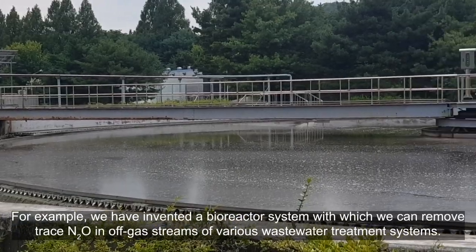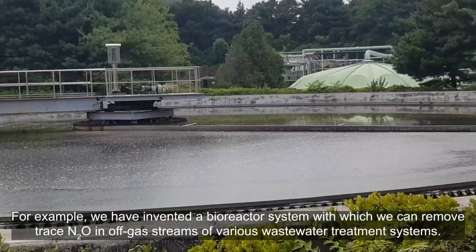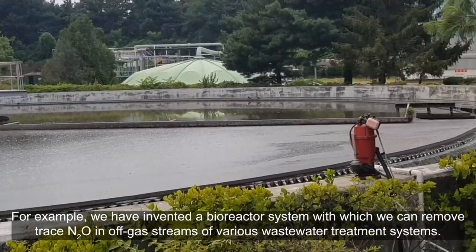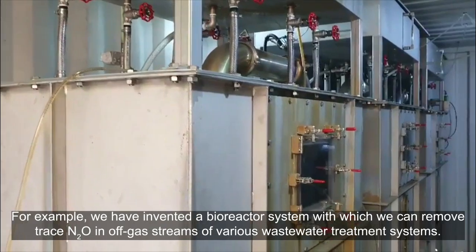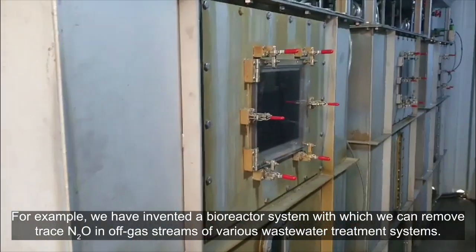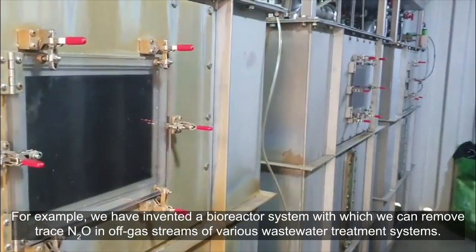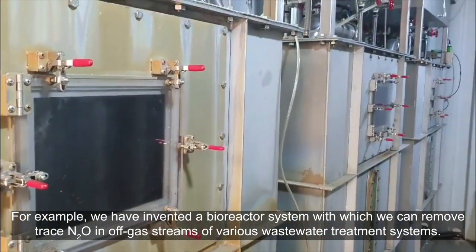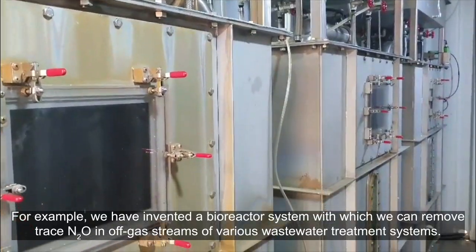For example, we recently invented a bioreactor system with which we can remove trace nitrous oxide in off-gas streams of various wastewater treatment systems.